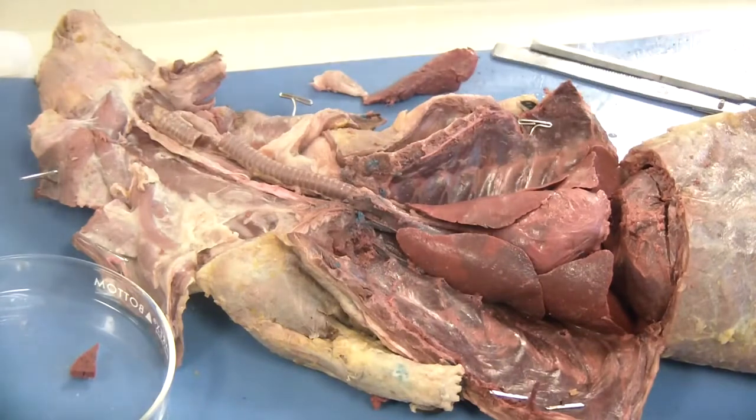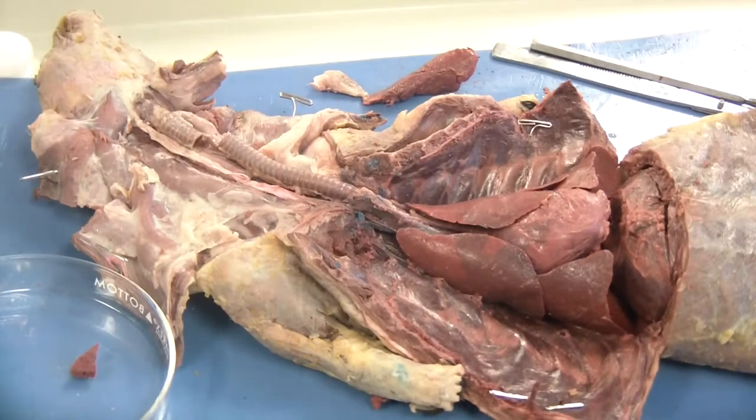The last thing it asks you to do is to look at the prepared slide of the lung and we are going to make some comparisons. Those are the instructions for the respiratory system and endocrine system investigation.